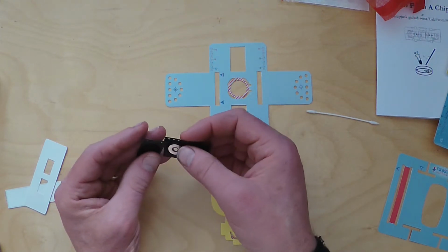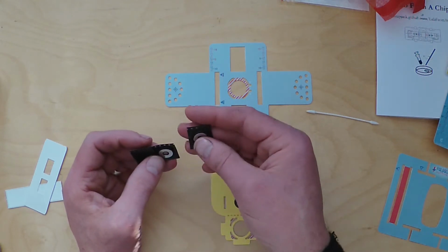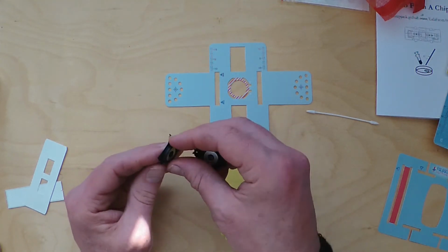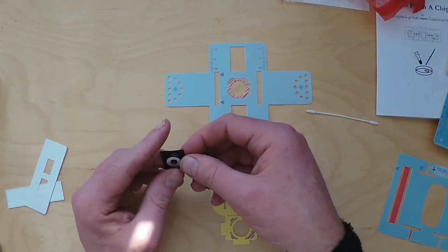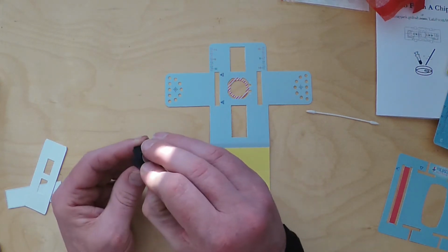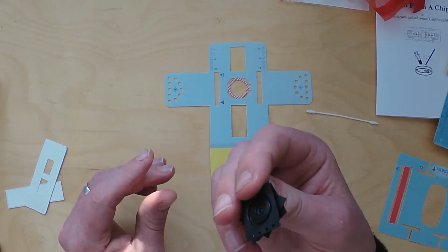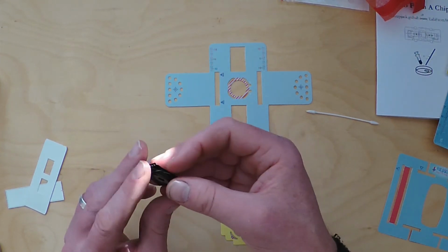So to make that many lenses, it's manufactured on a strip of metal tape, which is taken from mass manufacturing of PCBs and circuit boards and other electronic things, which they've used for this process. So you'll see that each one of them is magnetic in a certain way. Obviously some things will repel each other, but the other way around, they'll snap together. So they will jump onto each other if you're not careful. They're quite powerful magnets, and you'll see why they are later on.